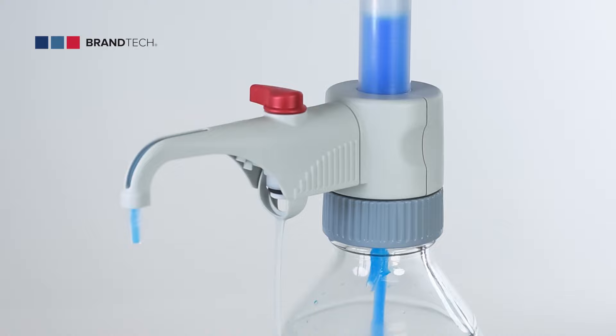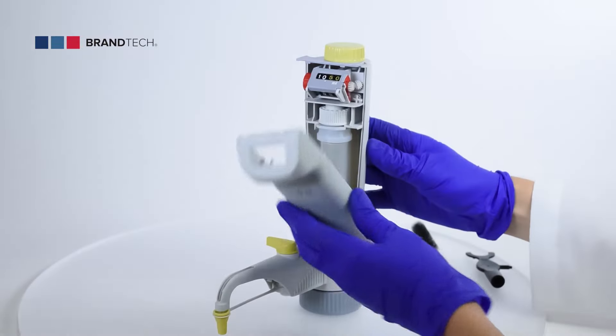When dispensing is finished, never leave the cylinder full. Return the recirculation valve to the recirculation position and empty the cylinder.